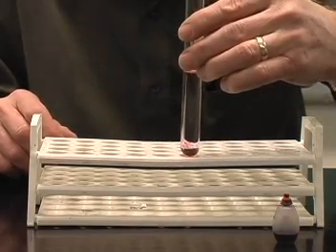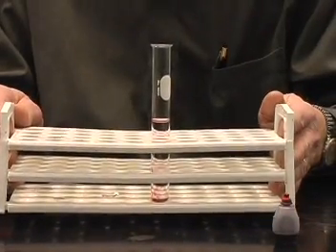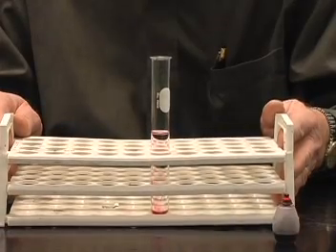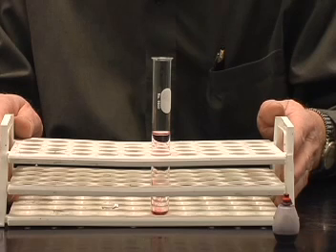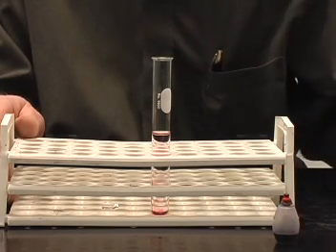We can then let that stand in a test tube stand overnight and see how far the color has actually diffused. You'll be amazed at how slow the diffusion actually is in a liquid. It can take several days for the food coloring to diffuse throughout the test tube so that we have a uniform color throughout.